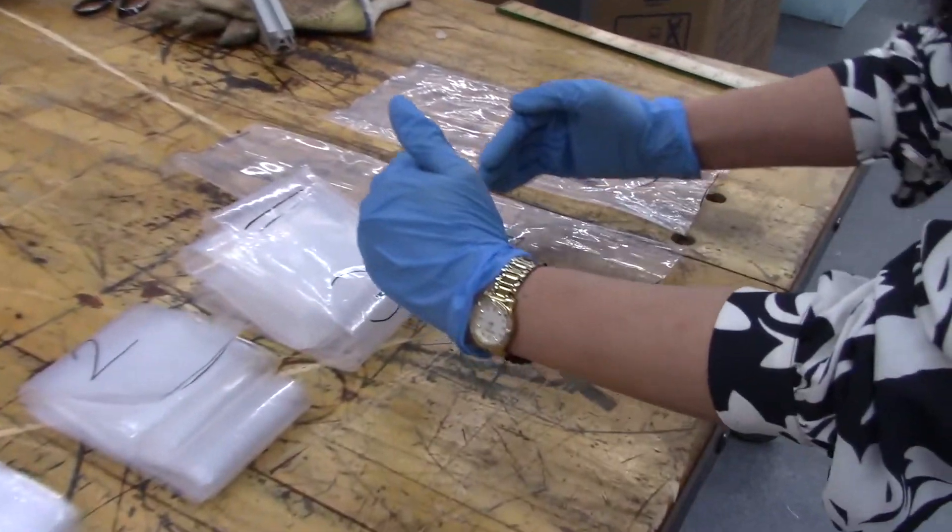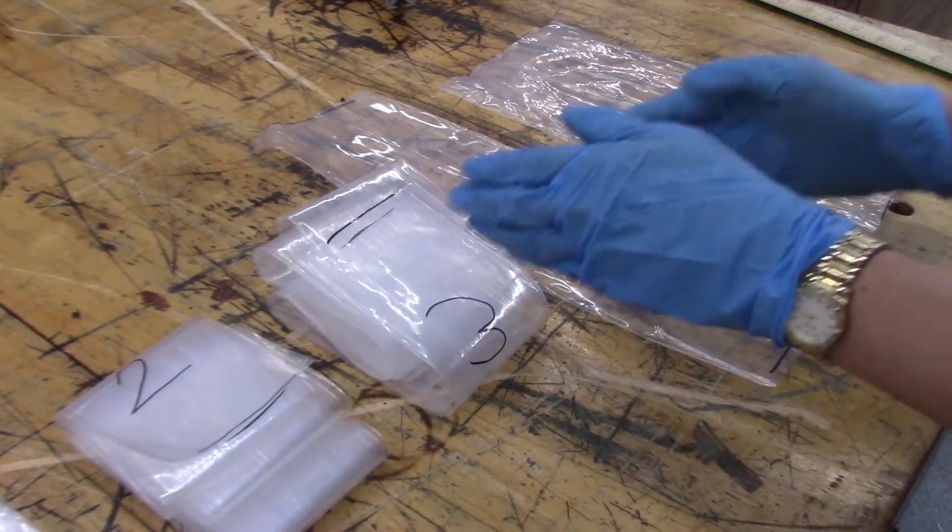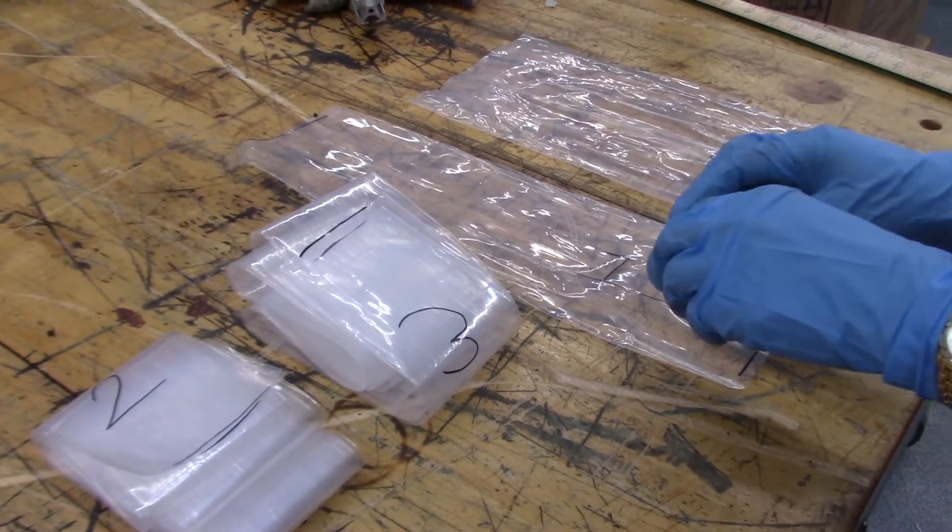We are also going to compare the diameter of these three samples which we obtained with different internal air pressure.